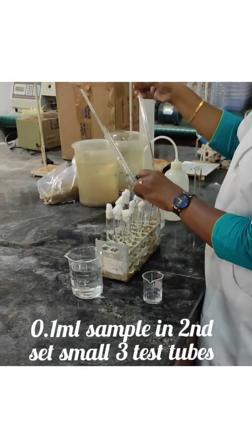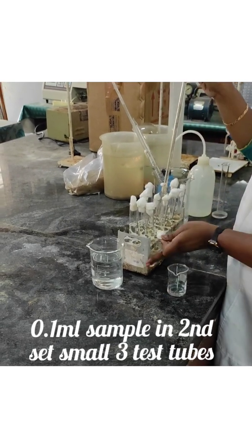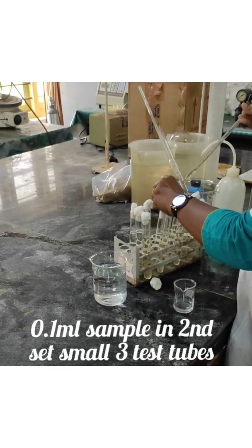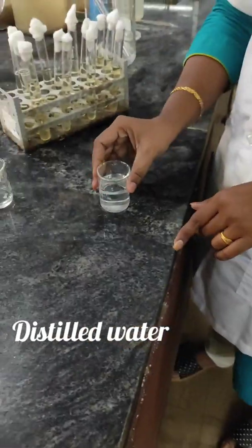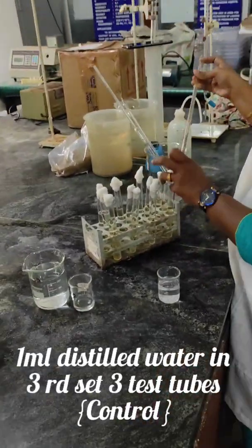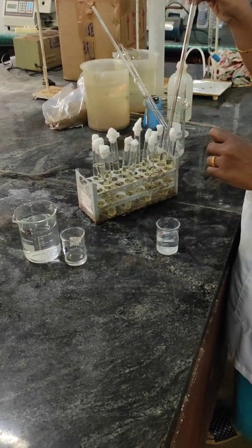Pipette 0.1 ml of water sample into the second set of small test tubes. Then add 1 ml of distilled water into the third set of small test tubes.